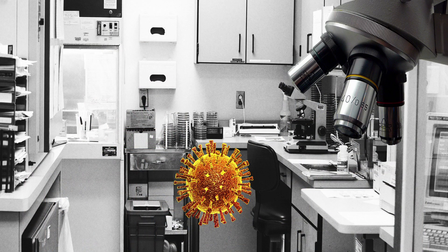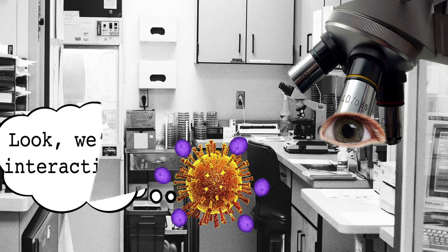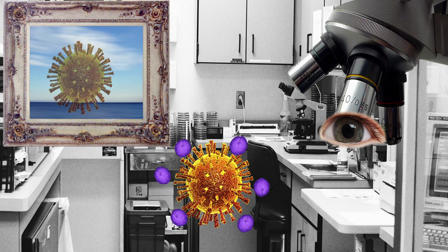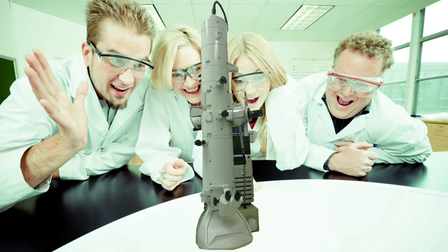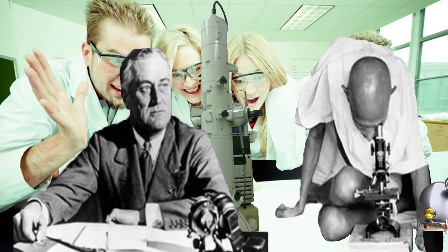The detectors are like the eyes of the microscope. They're able to see the various ways that the electron beam interacts with an object, and they use this information to produce detailed images of the object's surface. There's no doubt that these microscopes use some astonishing technology. But they're far from new — in fact, electron microscope technology dates back to the 1930s.